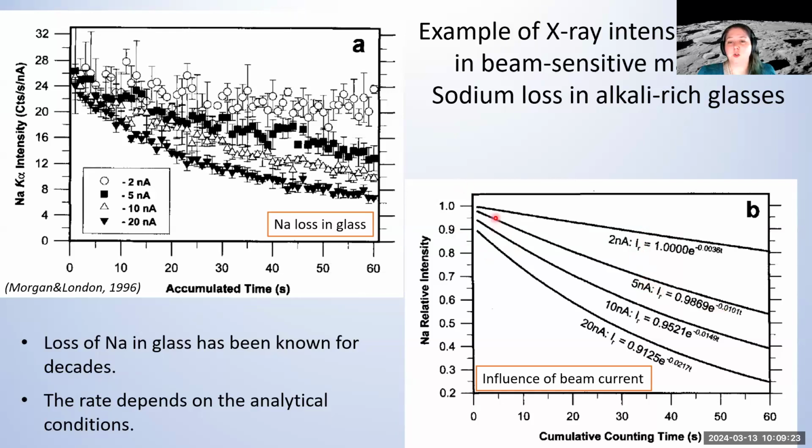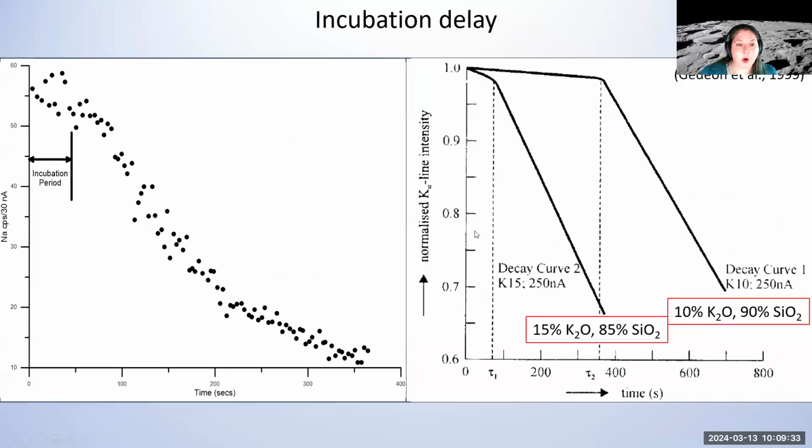And what we are really interested in is the composition here at time 0. And you can even see that sometimes the change really happens within the first few seconds. So that's a problem. Furthermore, sometimes it not only can a change happen in the first few seconds, instead it can actually take a moment to on-ramp, have some kind of incubation period, and then change.